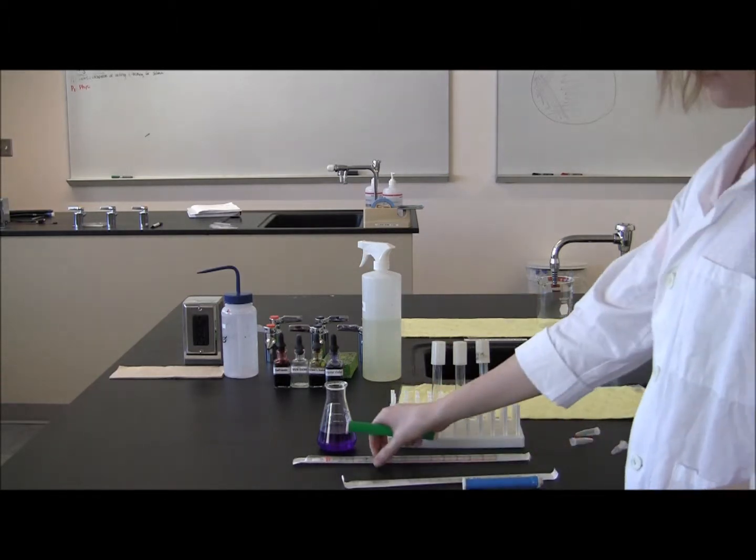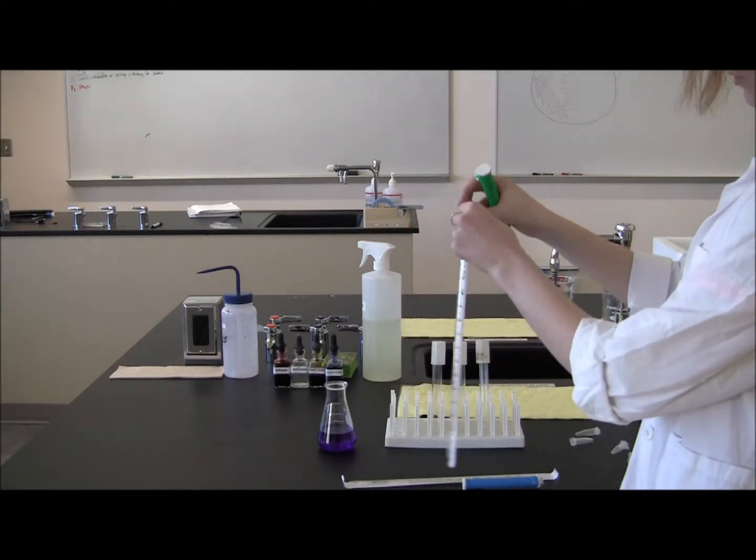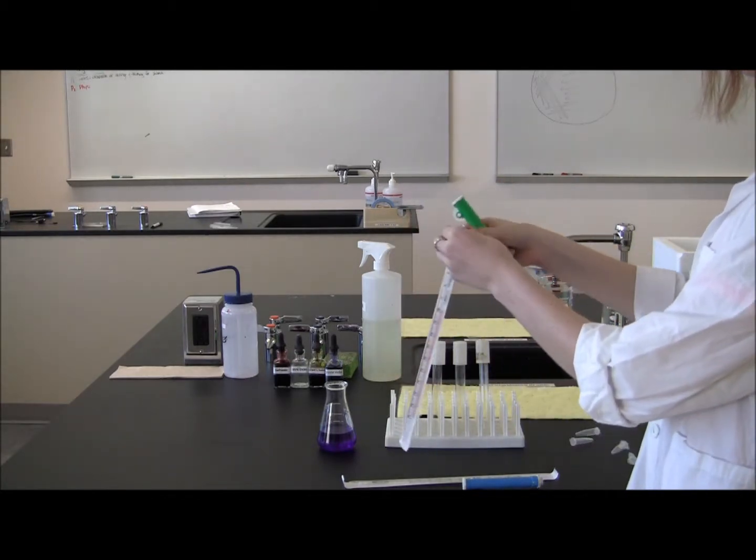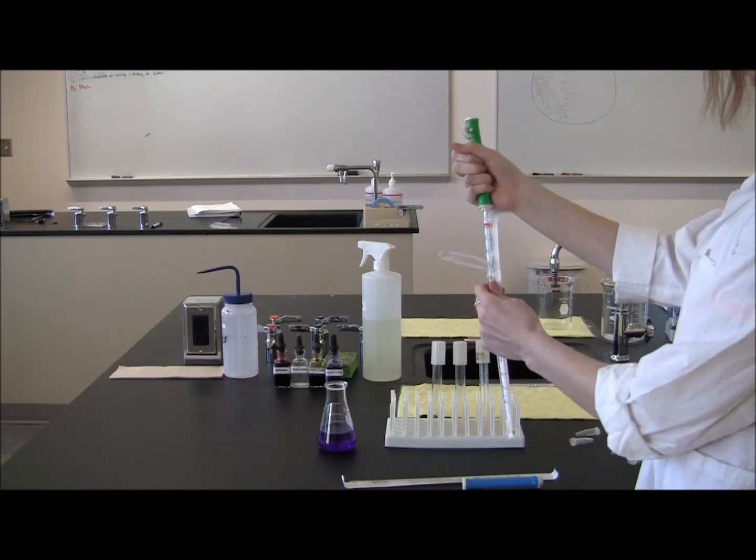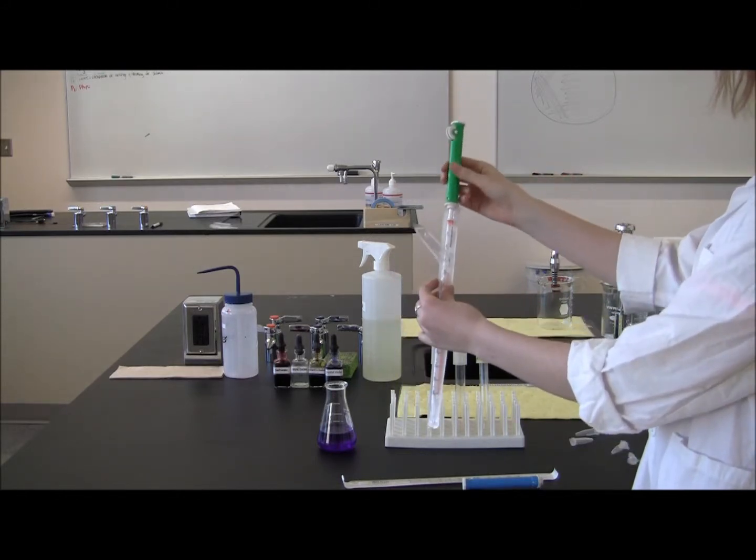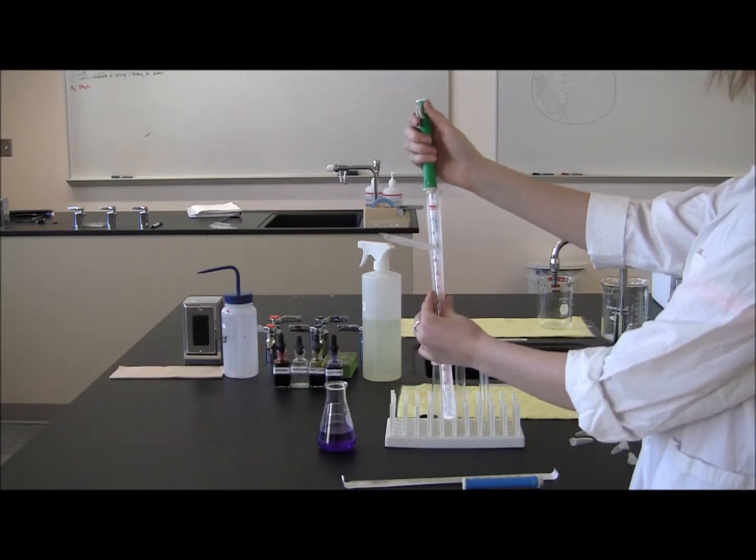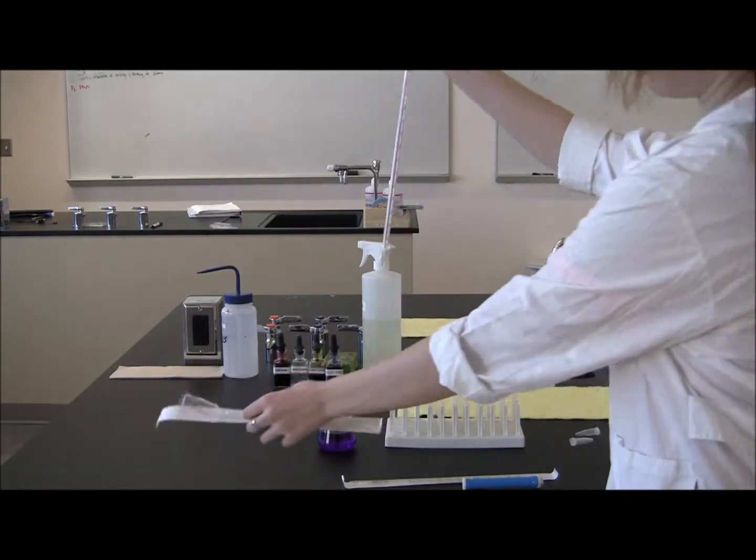So first you take your pipet pump and you open the pipet, stick the pump on, and make sure that you're not removing your pipet until you're ready to go into your liquid. So you take this out.